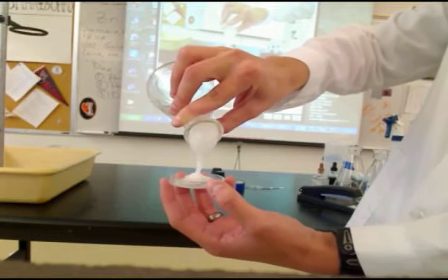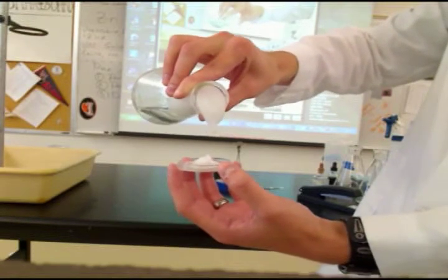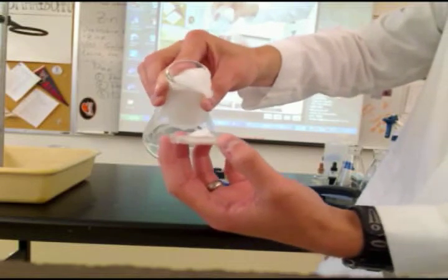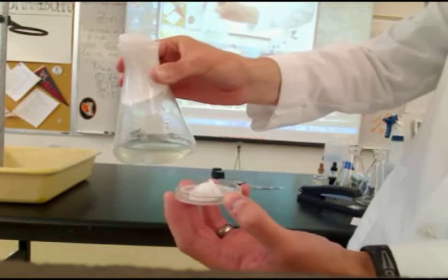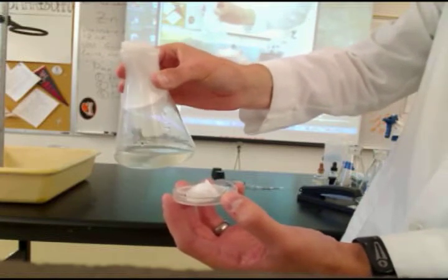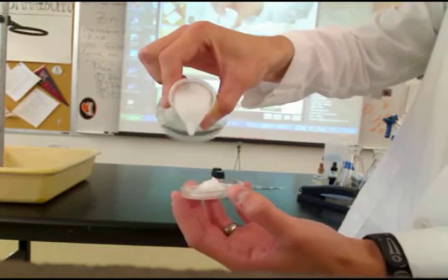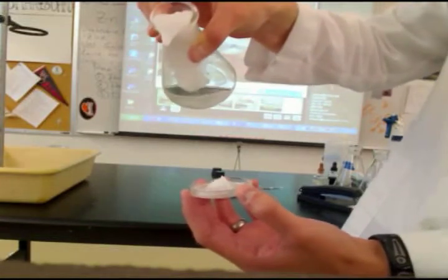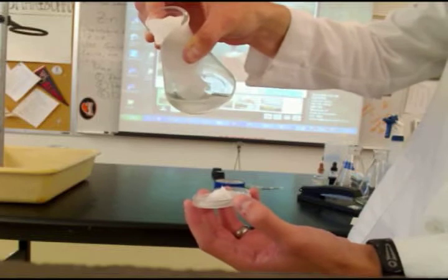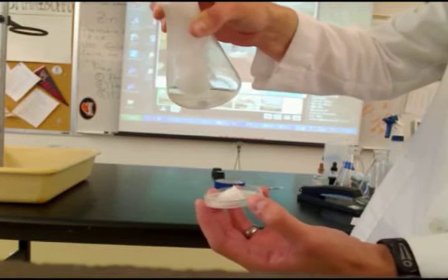Whoa, that's so skinny. And it's creeping down the sides of the beaker or the flask. See it creeping down the side there? What is it doing? It's freezing.